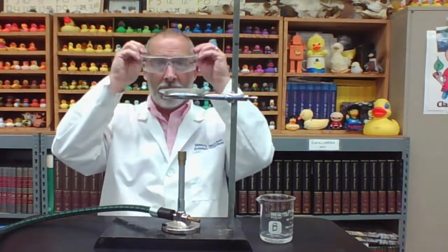All right, we're back. Hopefully you made some good observations so far. And now we are on step 6. I've set up a Bunsen burner, ring stand, and evaporating dish. And I'm going to be putting our extra safety goggles on over top of my glasses because we are about to light up the Bunsen burner. And so this is a very important safety. Always remember to wear your goggles.